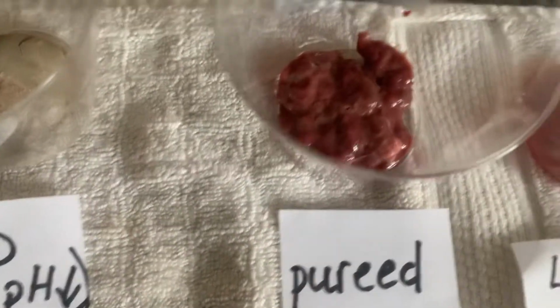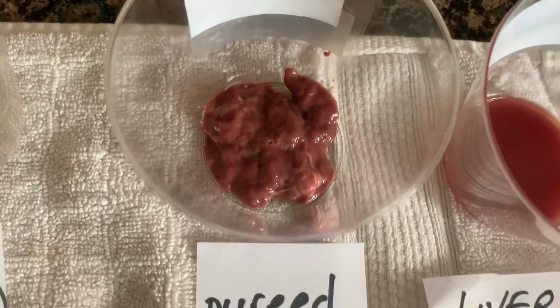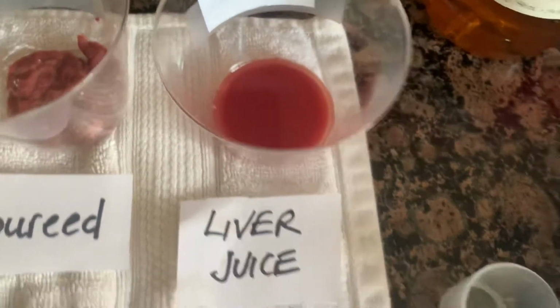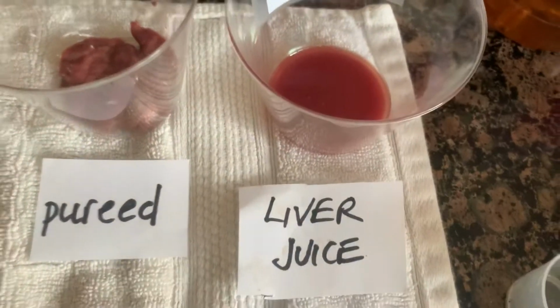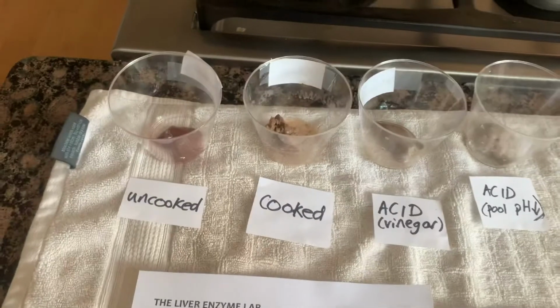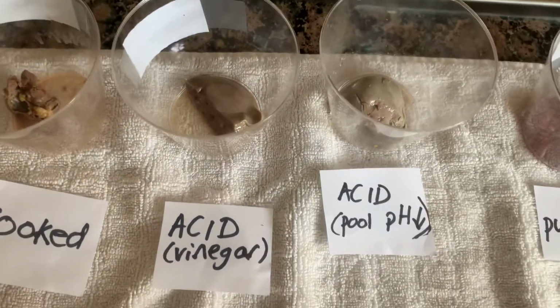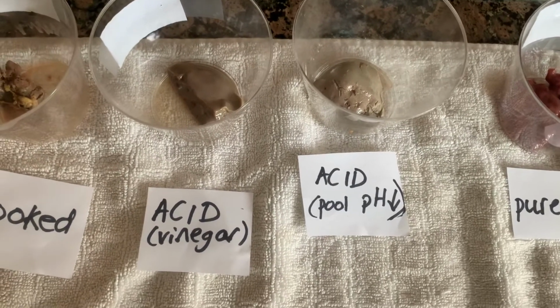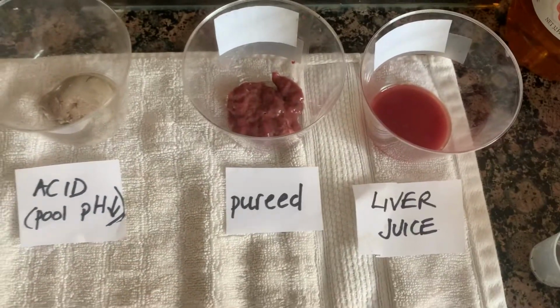Then the next one is pureed, so it's the uncooked liver just ground up there. And then the last one is liver juice, so the livers come in the package and they're in the juice of the liver. Okay, so we've got those 6 different things: uncooked, cooked, placed in acid, 2 types of acid. One is vinegar, one is the pool acid, and then pureed and liver juice.